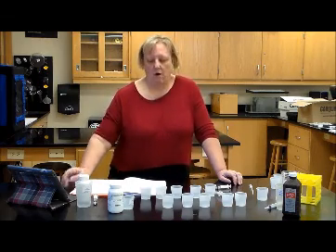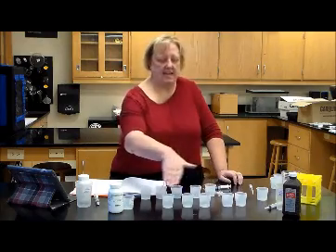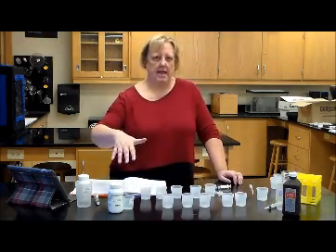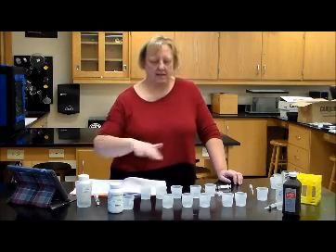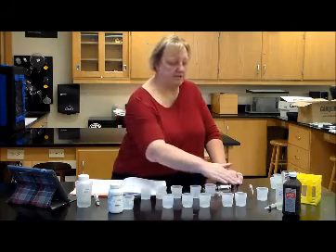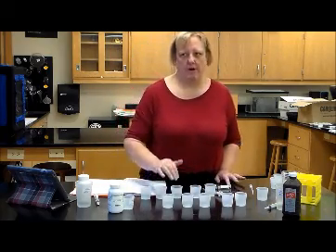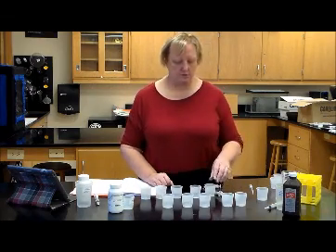Once you've added the sulfuric acid, these can stay overnight because you've stopped the reaction. Nothing else is going to happen. The catalase is done. The hydrogen peroxide is taken care of. Nothing else is going to happen to these cups. So if you have to stop, you can stop at that point and continue this part on Thursday. If not, you're going to do titrations.